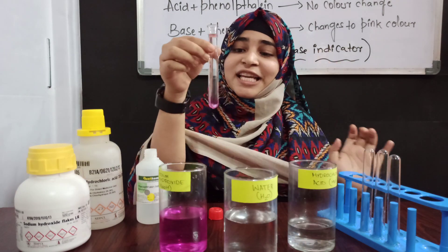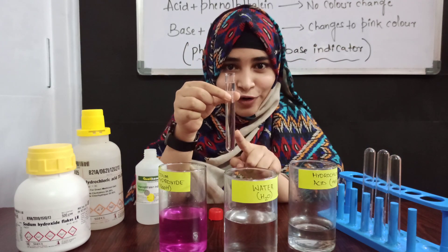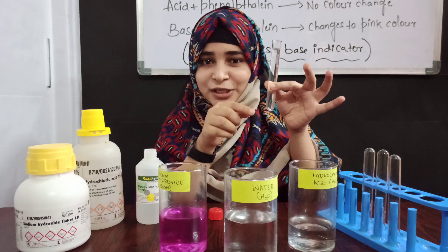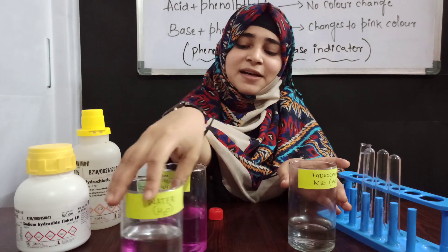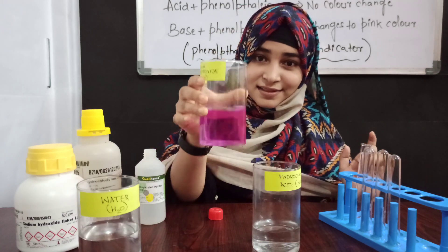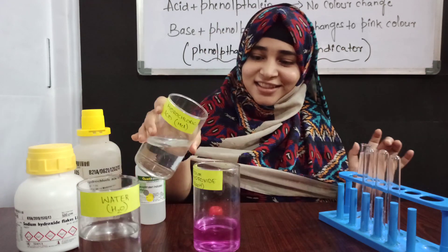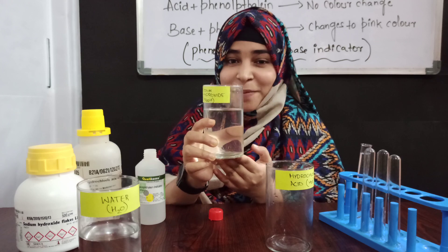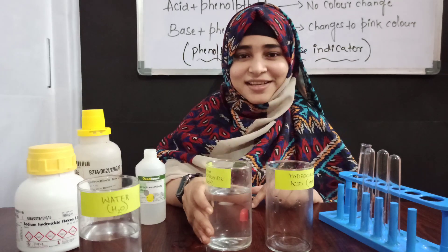As you can see, it turns to a colorless solution. Here it is forming salt and water — sodium chloride and H2O. The salt is dissolved into the water so you cannot see it separately. This is like a magic — it's forming salt and water. So this reaction is called the neutralization reaction. Thank you so much.